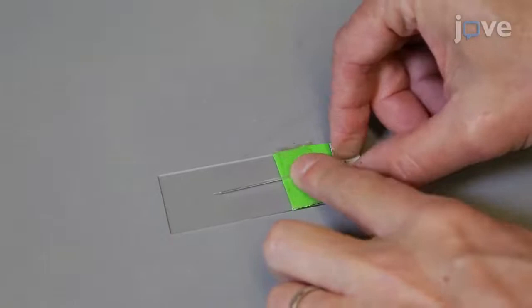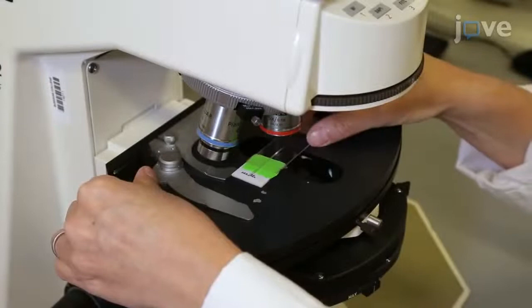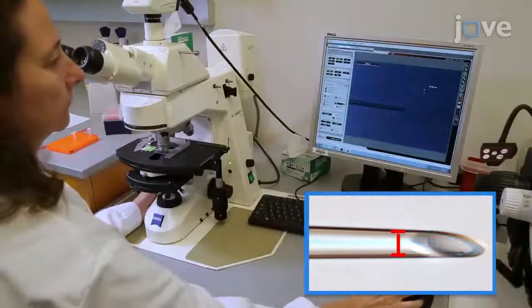Assess the bevel by placing the beveled needle on double-stick tape that has been adhered to a glass microscope slide. Place the slide on the stage of a compound microscope equipped with a camera and image acquisition software. Acquire an image of the needle using a 20x objective.